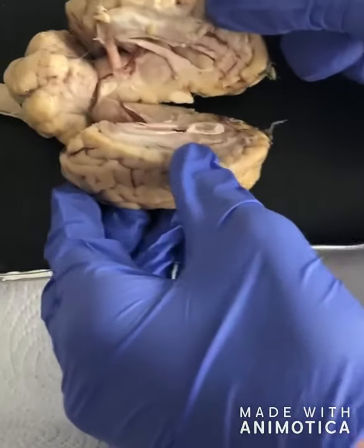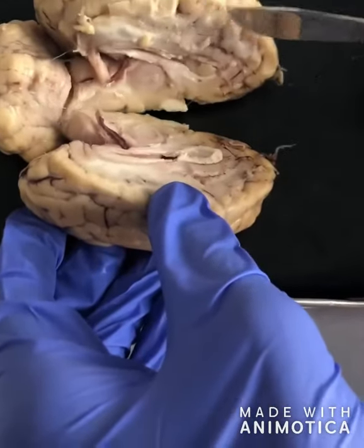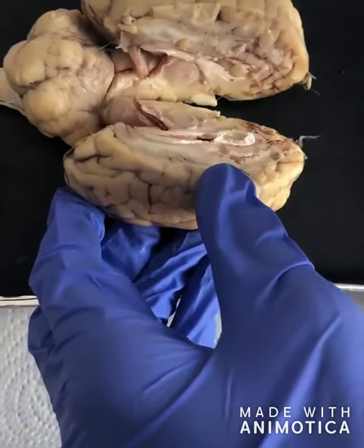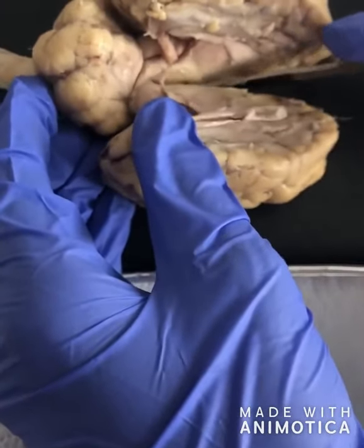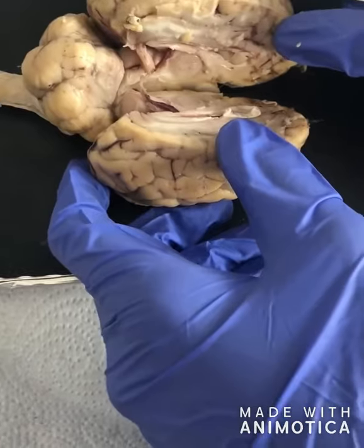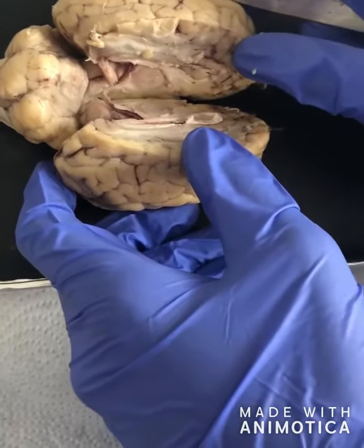There are 2 lateral ventricles located in the left and right hemispheres of the brain, which go towards the frontal, occipital, and temporal lobes. Next is the choroid plexus, which is located in the ventricular system, and it circulates spinal fluid. The choroid plexus structures are found within both lateral ventricles, as well as the 3rd and 4th ventricles of the brain, and the optic chiasm is located at the bottom of the brain, where the right and left optic tracts intersect.